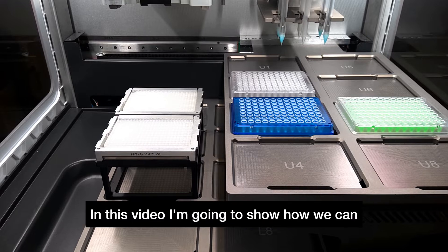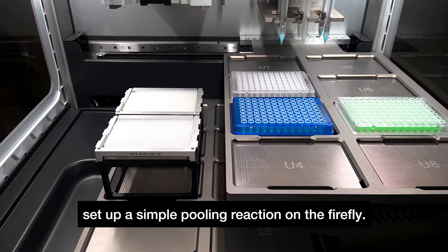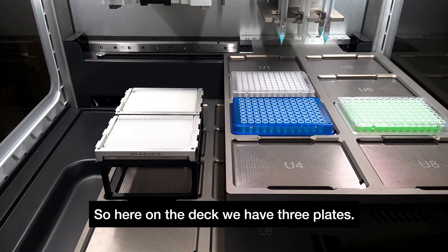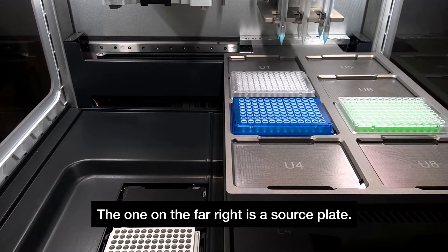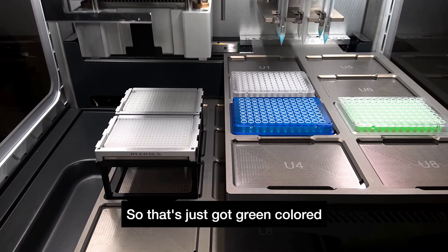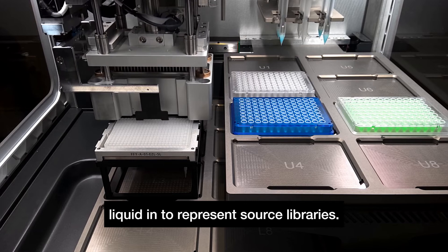In this video I'm going to show how we can set up a simple pooling reaction on the Firefly. Here on the deck we have three plates. The one on the far right is a source plate with green colored liquid to represent source libraries.